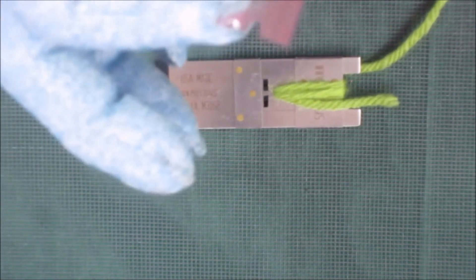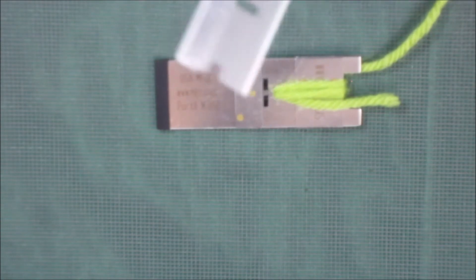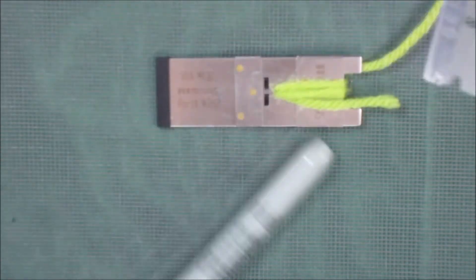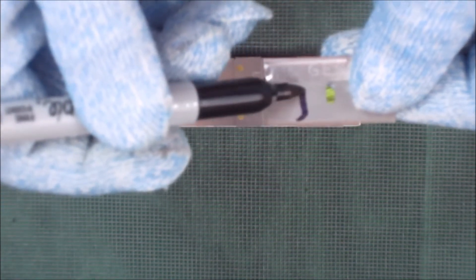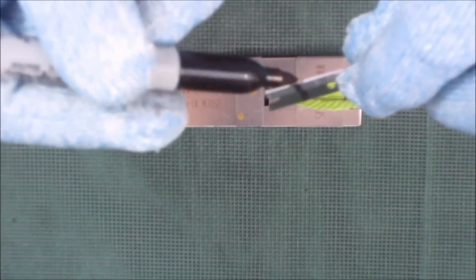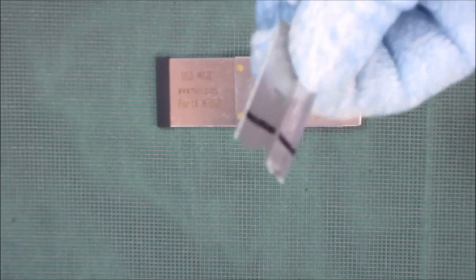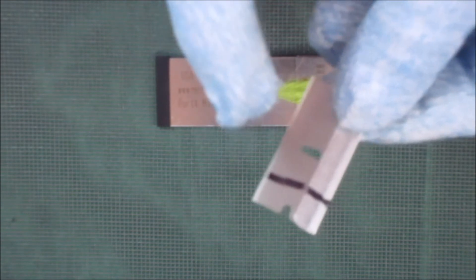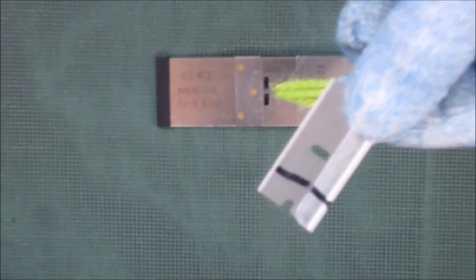Now the other thing with the razor blade, as I told you, you can only use it once per sample. That means you get two cuts out of one razor blade. I'm going to mark half the razor blade on both sides, both faces, the same half on both faces. That's going to be the half that we're going to use for one cut and the half that doesn't have a mark we're going to use for the other cut.